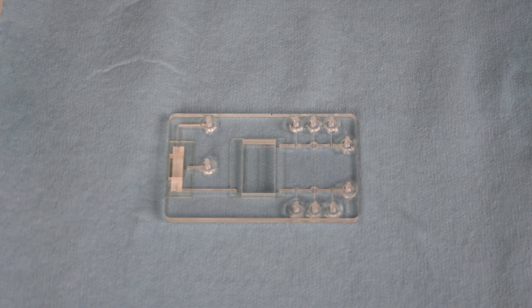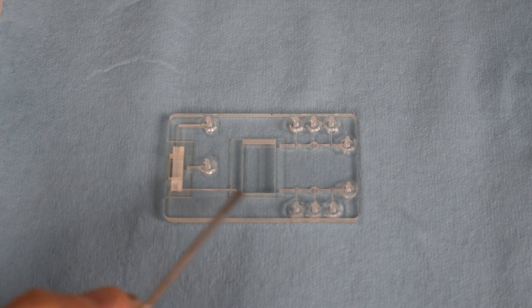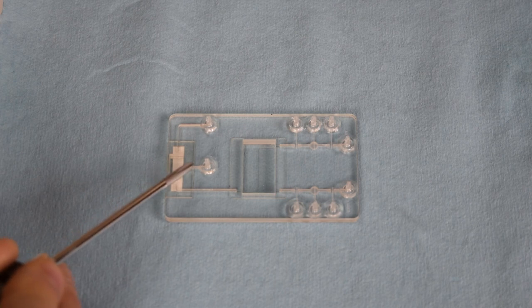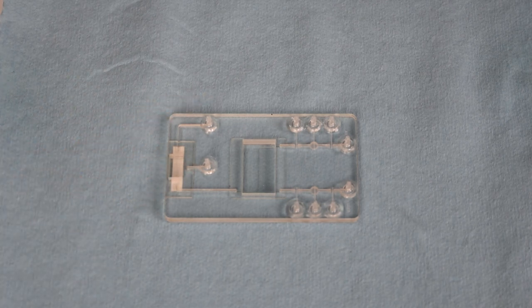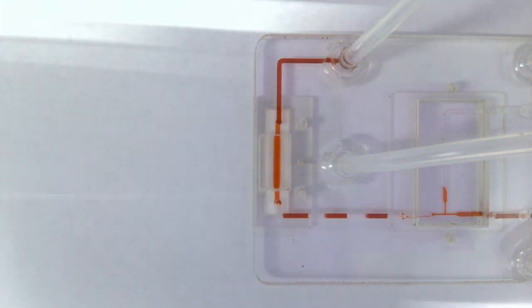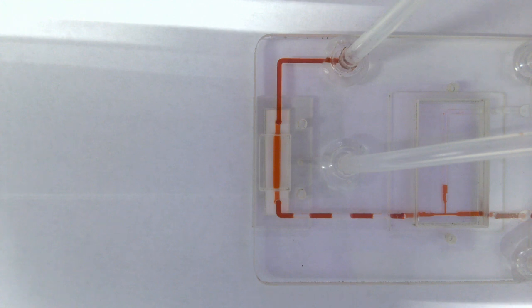To replicate the occurrence of bubbles in a microfluidic pump, the system is set to desired PSI, vacuum, and air ranges and creates a stream of bubbles that you'll see here from strokes of air and liquid into the system. These bubbles are now stuck in the system, and as you'll see from the video, the debubbling mechanism made with Porex Virtek will remove the bubbles before it goes to the exit channel. Now you can see the fluid flowing in the video, and you can see the bubbles forming and how the bubbles are now being trapped in the system.